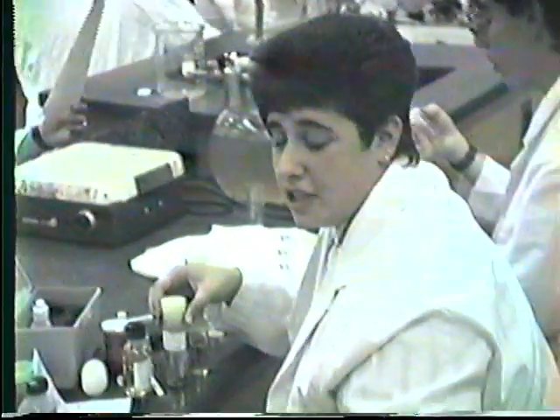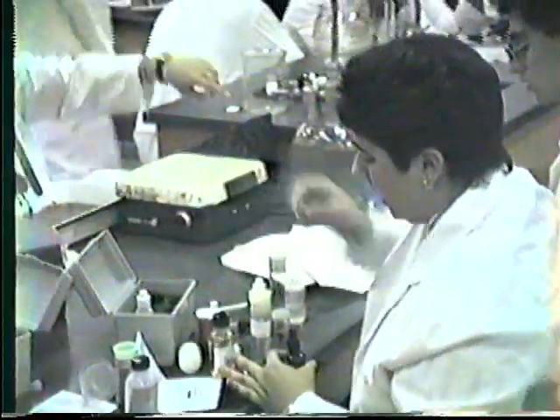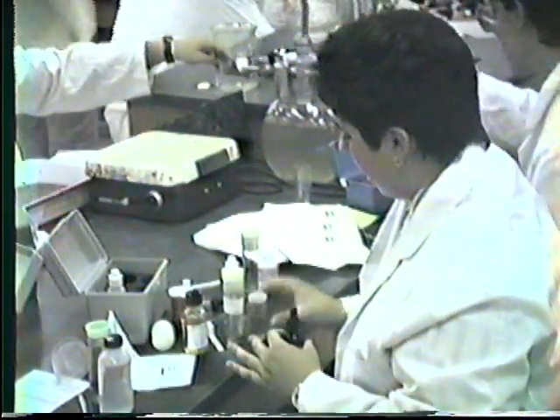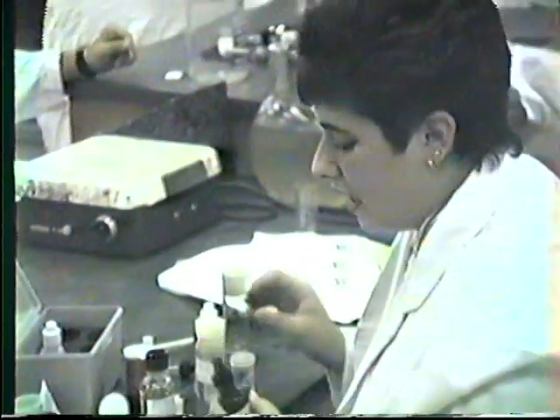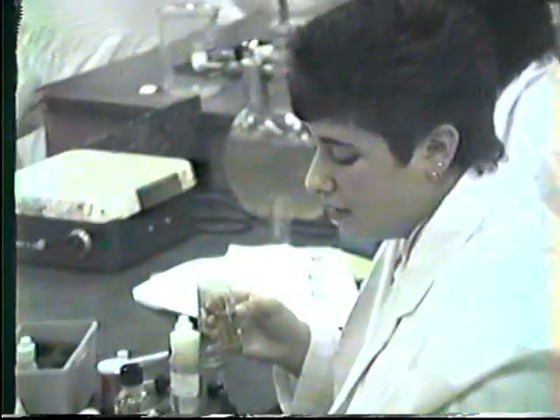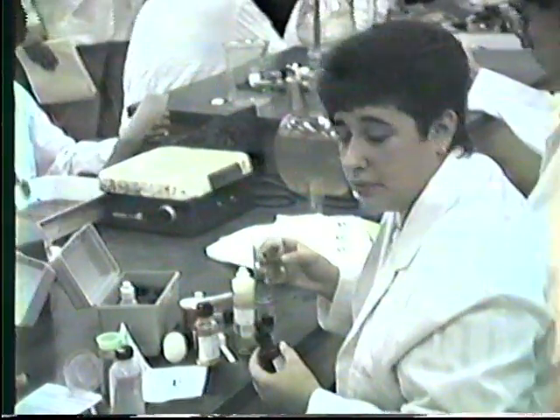I poured it in here, and I added chemicals to fix it so that no more oxygen would get in it. And then I put it in this vial, and I had to add some sodium thiosulfate, and now I have to finish titrating and adding the rest of the chemicals. And I'm going to add some starch, and I'm going to find out how much dissolved oxygen is in it.